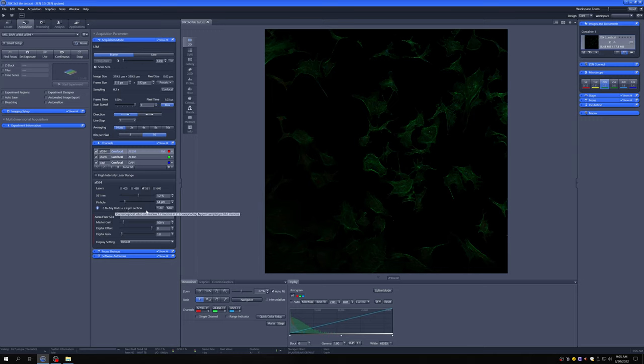And then finally, you can see here, this is the equivalent thickness of the optical section with the pinhole set to this size, meaning we did not cut this sample. I just got it in the mail from a company. But if we had wanted to get an image of this kind on a wide field microscope, this is how thin we would have needed to cut it. That's sort of the explanation for what this means. And you can see that as I move this, if I make it bigger, the optical section is bigger and the airy units are bigger.